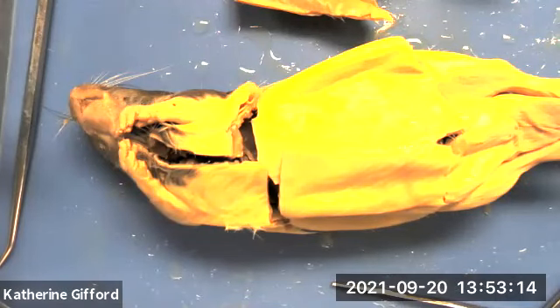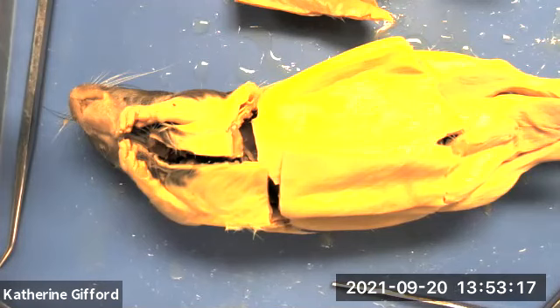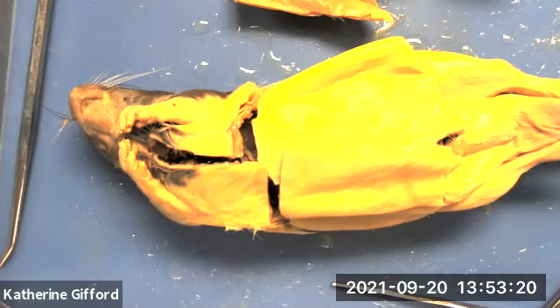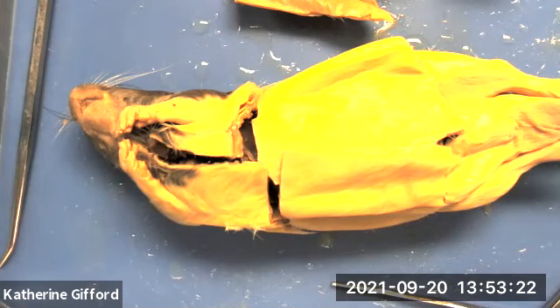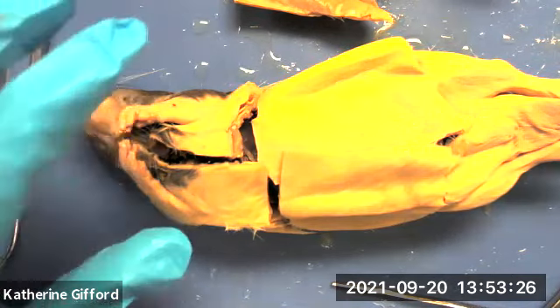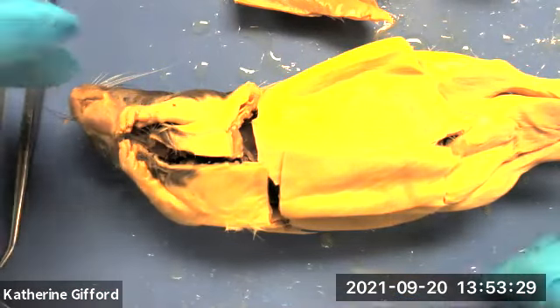This is the recording for both the digestive system structures and the reproductive system structures. We have the same rats that we had last time.